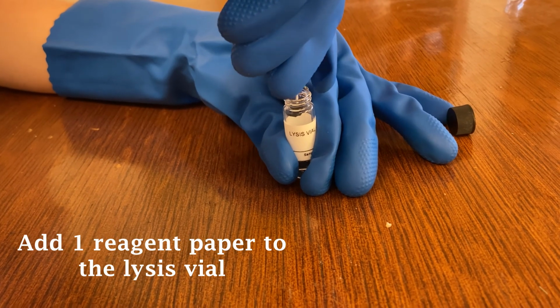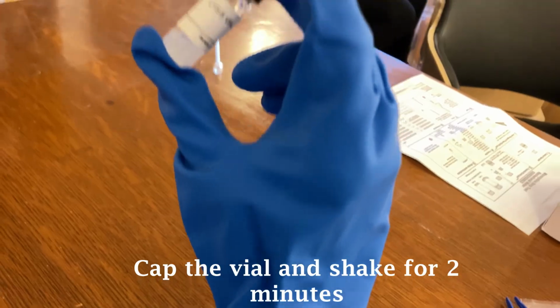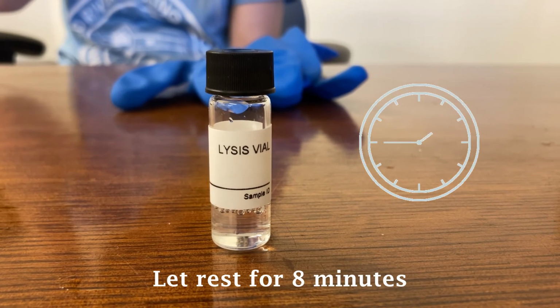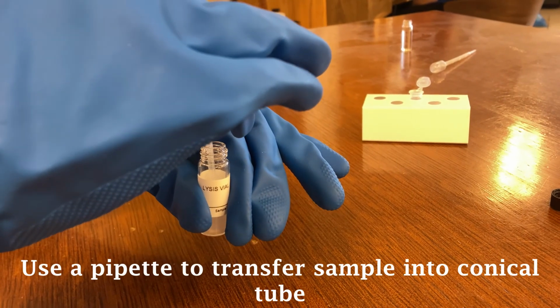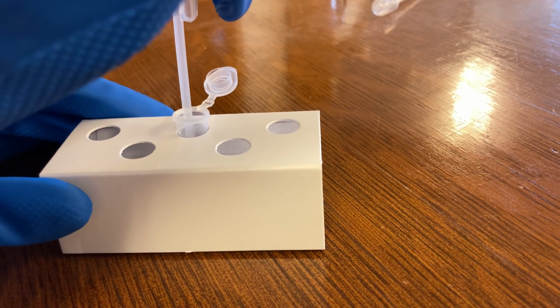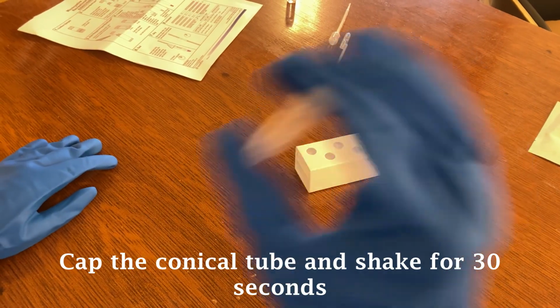Using the forceps provided, we added 1 reagent paper to the lysis vial. We then capped the vial and shook for 2 minutes, and afterwards let rest for 8 minutes. We next used a pipette to transfer the sample into the conical tube. We then closed the conical tube and shook it for 30 seconds.